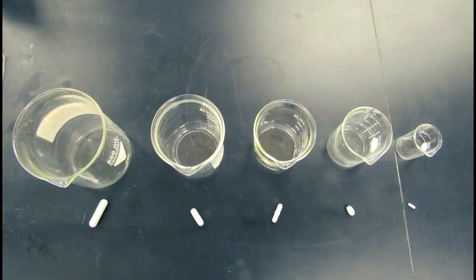We need to make sure we have the right size stir bar, as they come in many different shapes and sizes. As you can see, this glass is fairly large, so we want to use a stir bar that is also fairly large. If we use a small stir bar, then the liquid won't stir very well.